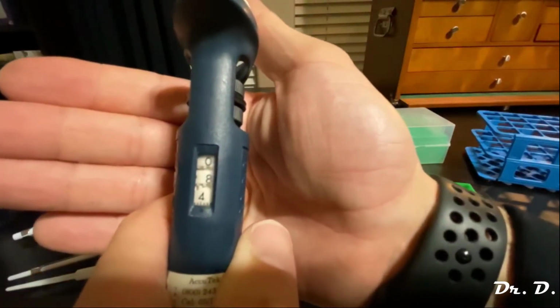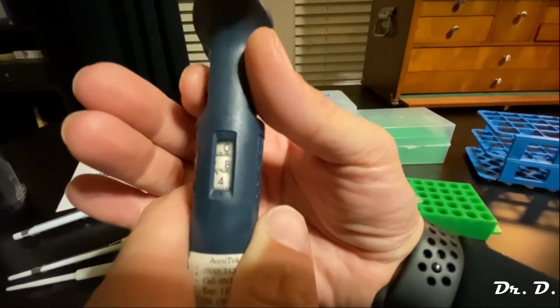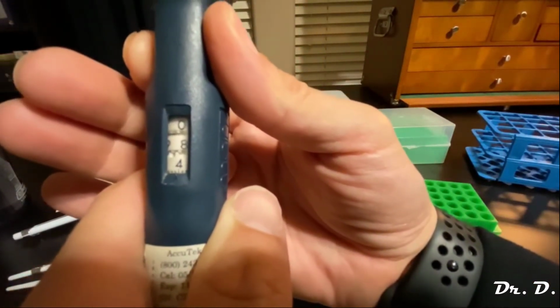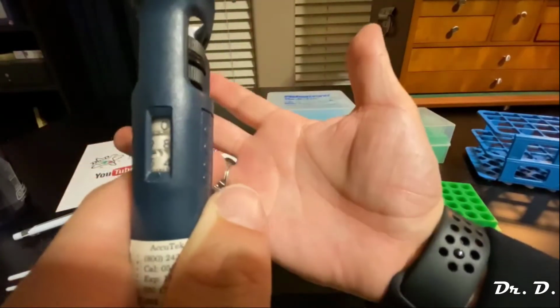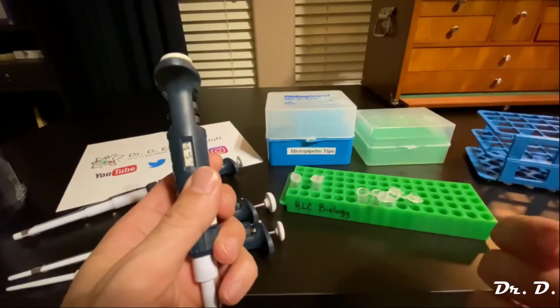84. What if I wanted 84.4 or 84.5? How would I do that? 84.2, 84.4, 84.5. There you go. That's 84.5. You see how it works? So I have 84.5. Okay.